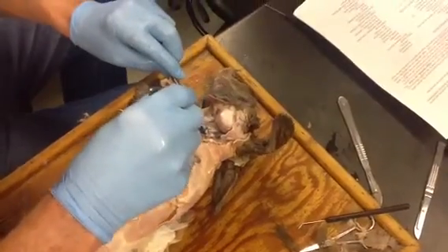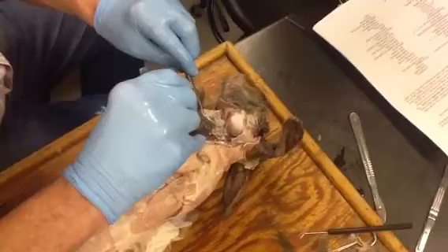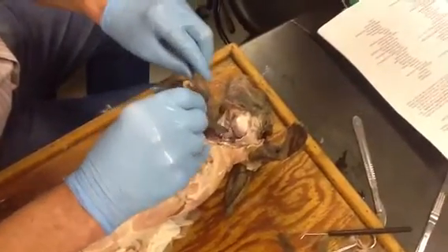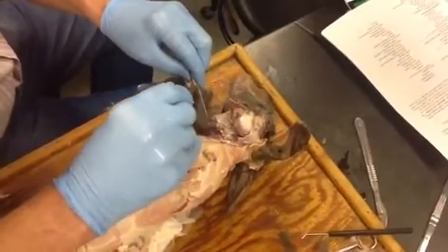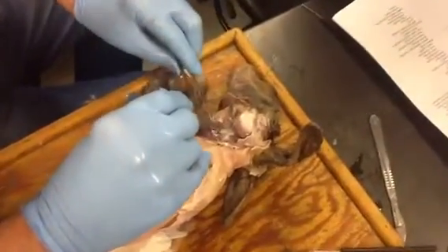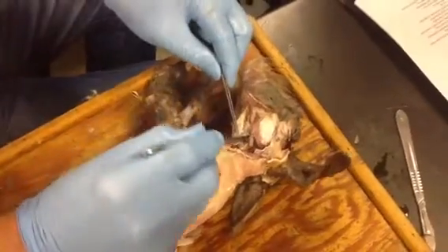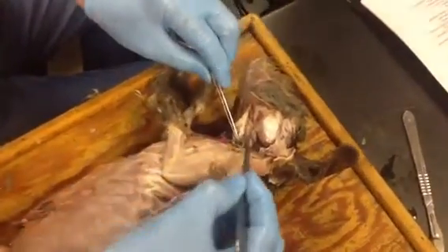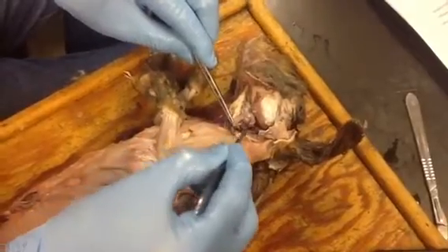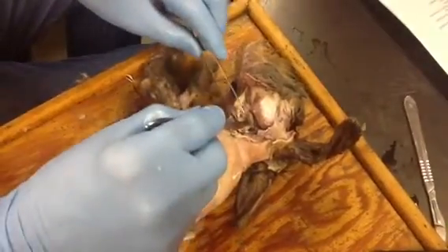Oh, that's a little lymph node there. Oh, those are what blow up when you get sick — like a golf ball? That could be. No, that isn't — that's a salivary gland. That's a submandibular gland now that I've got it exposed a little more. Look at how big and round it is there. Bunnies need a lot of saliva to moisten up the grass and carrots they're eating.